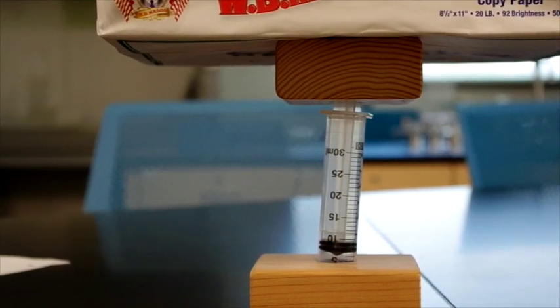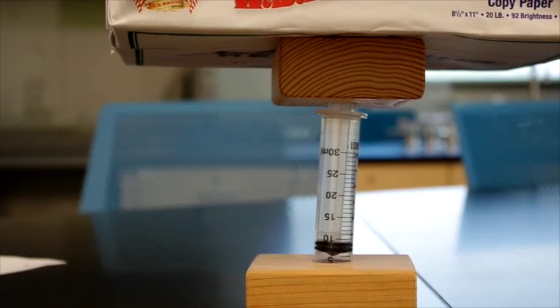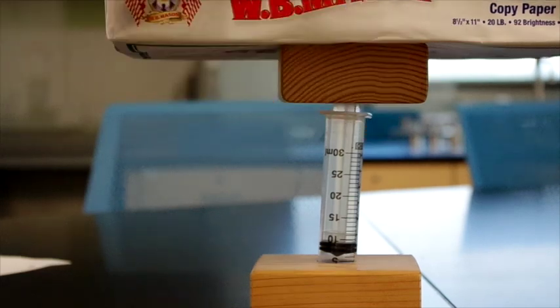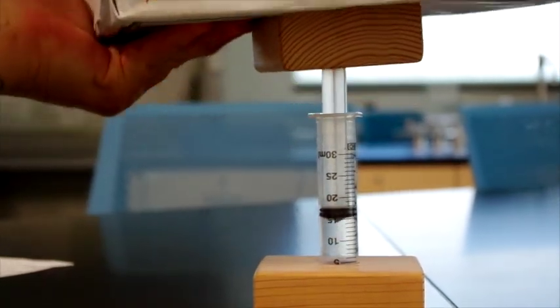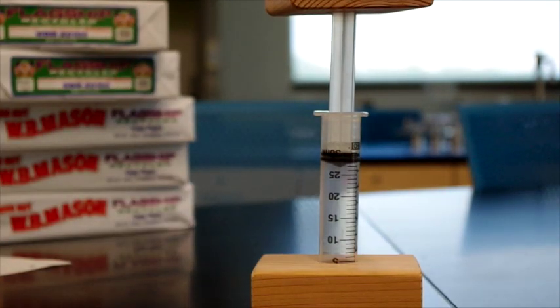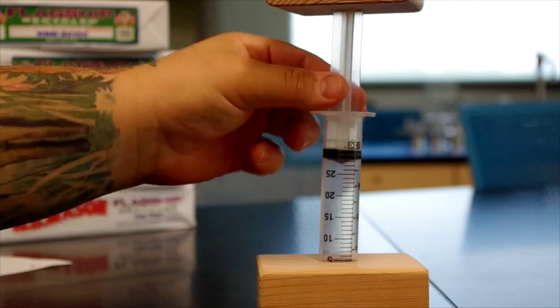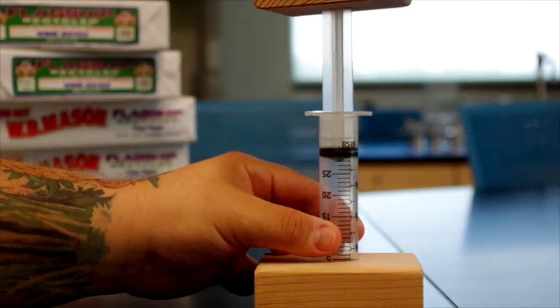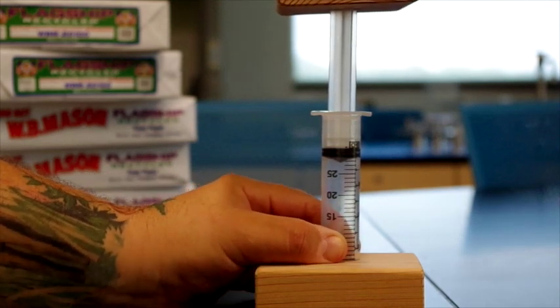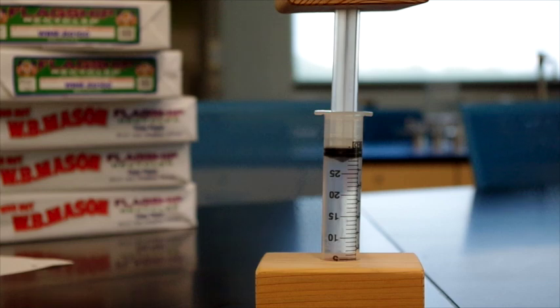So you notice that that relationship is not exactly linear, which you will discuss in your lab report when you do graphs of this data. So now I'm going to remove these reams of paper. And lo and behold, given a little bit of time to readjust, the volume goes back up to 30. Well, it actually goes back up to 29. So that might mean that there was a little bit of gas that escaped in this experiment. So that's part A.